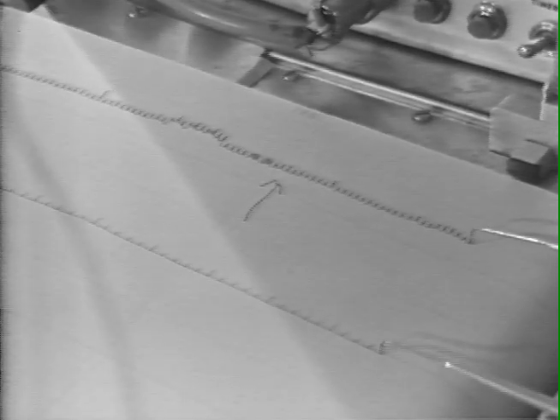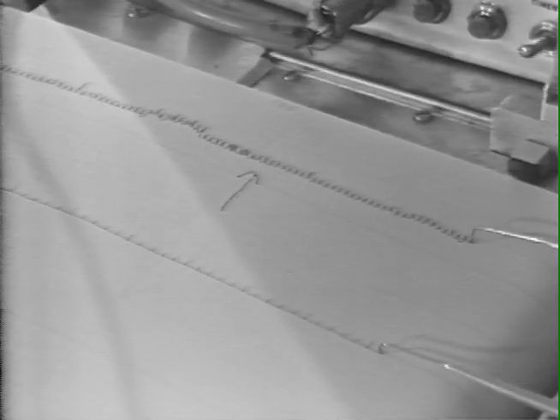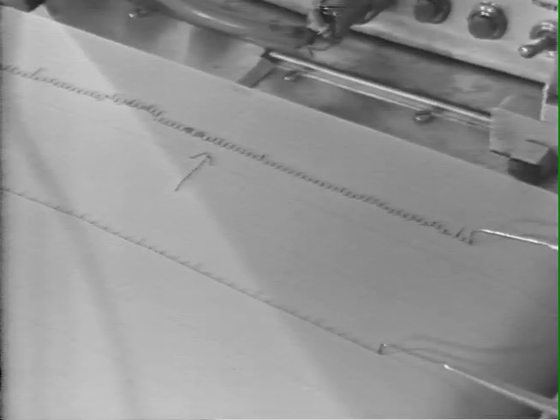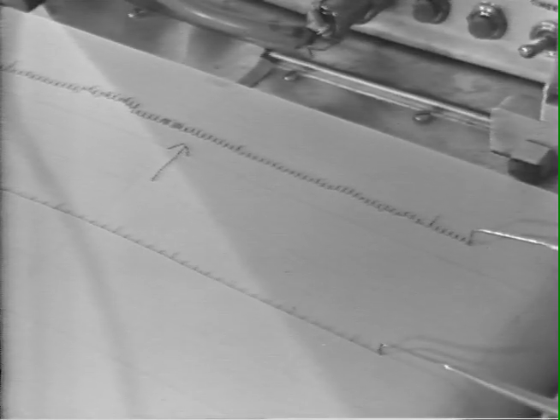We should not see a very rapid onset of the response at this low frequency. We will watch it only for 20 or 25 seconds, and then come back after the full time period has elapsed and look at the overall response.